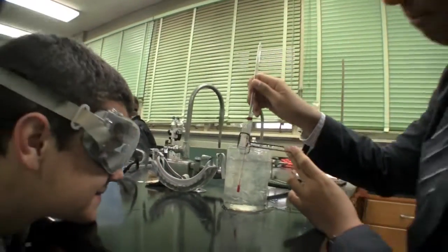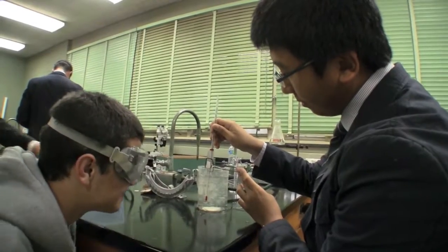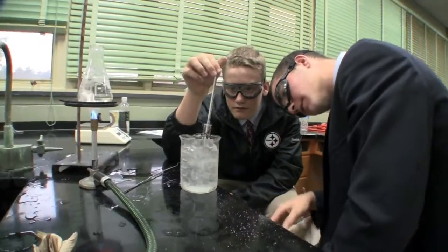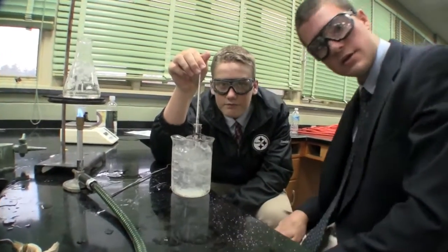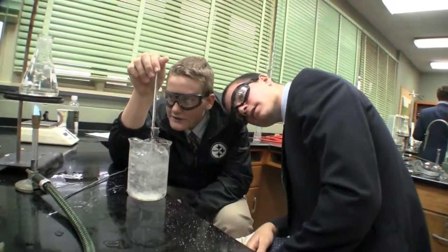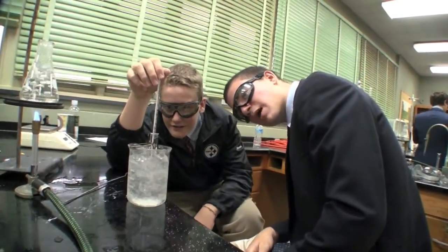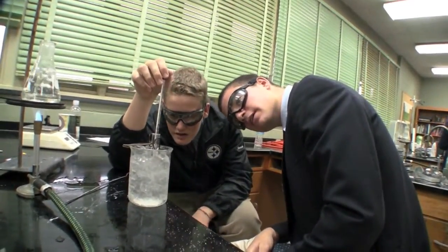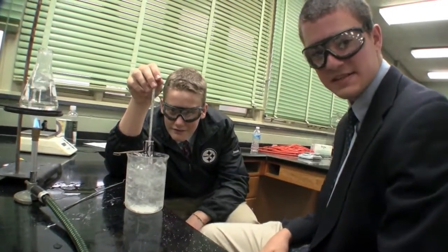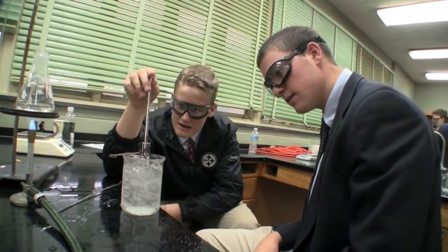Did we get some salt? A lot. All right guys, what temperature are you at right now? 65, because we just pulled it out — and dropping quickly. We've already gotten down to five. That's the lowest we've gotten so far: five degrees Celsius.